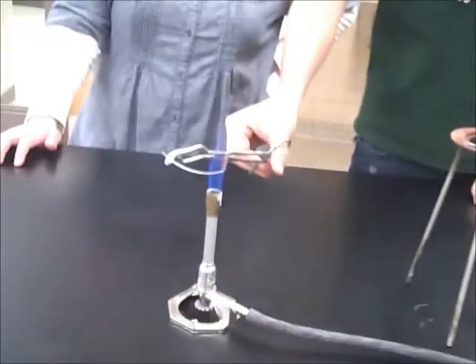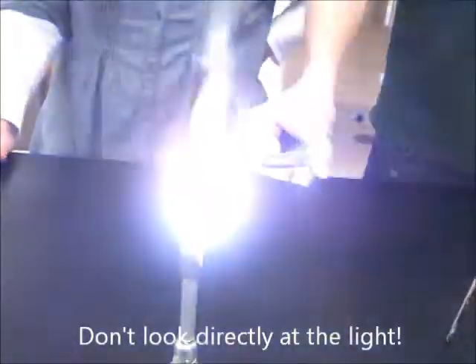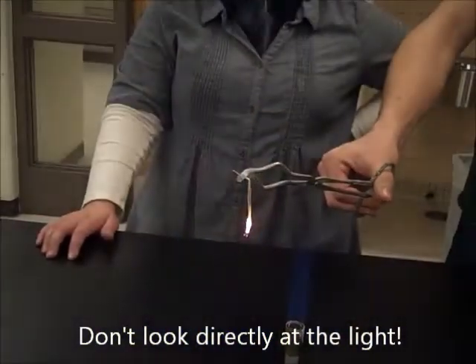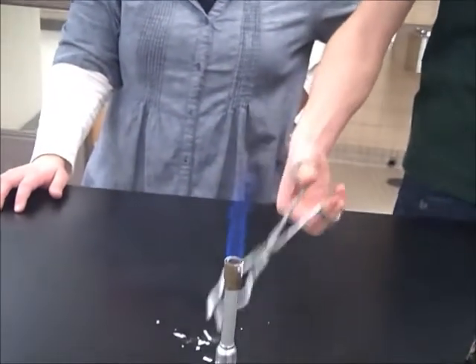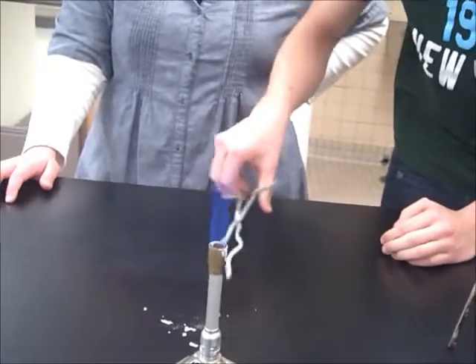All right, Nick, burn it. Do not look at the light. That was weak. Man, I never had anybody complain about magnesium being weak.